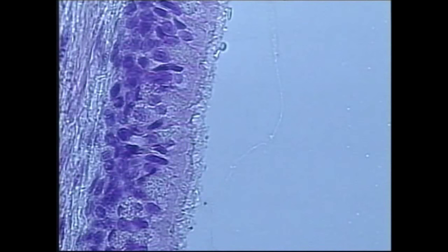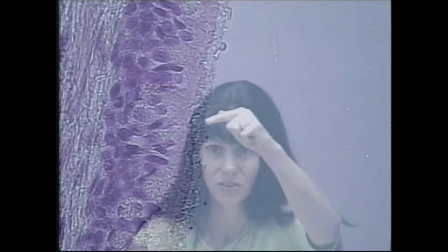You can find pseudostratified columnar epithelium lining the respiratory passageways. When we look at this slide, you can see that the nuclei are located at different levels from the basement membrane, which is right here. Even though they're at different levels, remember — every cell makes contact with the basement membrane, which is why we get the word pseudostratified. If you look at the free surface of the cells, you'll notice that there are cilia.